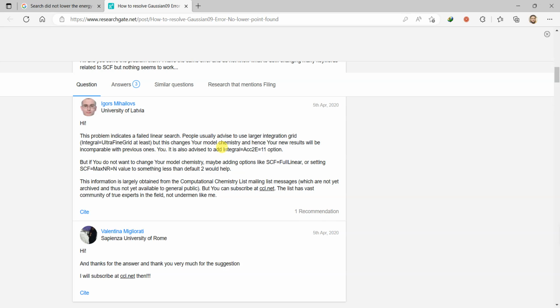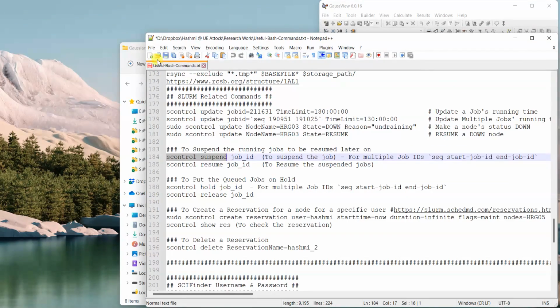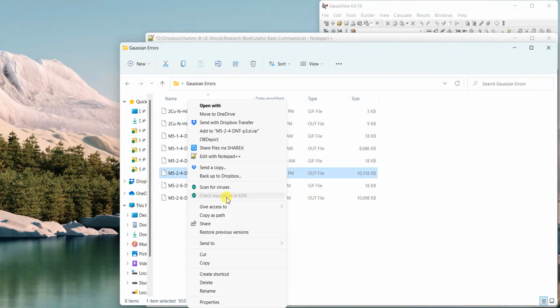So Googling something is really helpful. Always copy and paste that error code into Google and see what it says. Don't tell Google a severe error or run aborted or such kind of errors that GaussView shows. Instead, look for the error keywords in the output file like this one and copy those to Google, and it will tell you about that error.